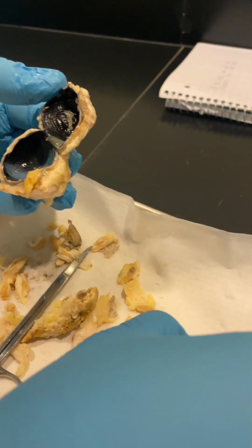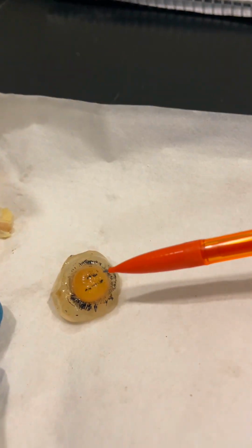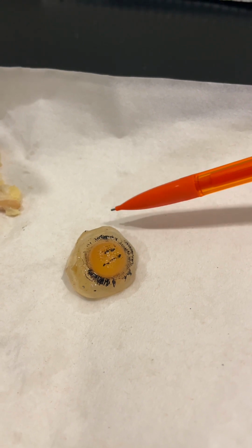It's the vitreous humor. The vitreous humor is a clear, gel-like substance that is located in your eye. It takes up the space between your eye's lens and retina. The vitreous cavity is the name of this space. The vitreous humor helps your eye keep its shape. Right here is the lens of the eyeball. And this liquid is the vitreous humor.